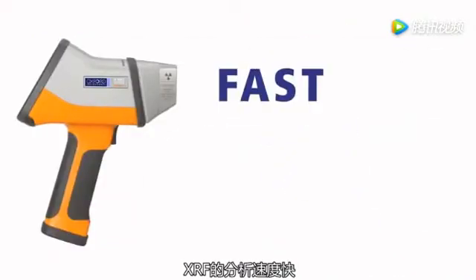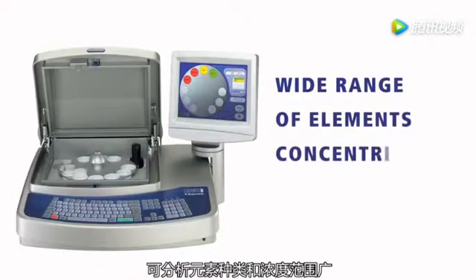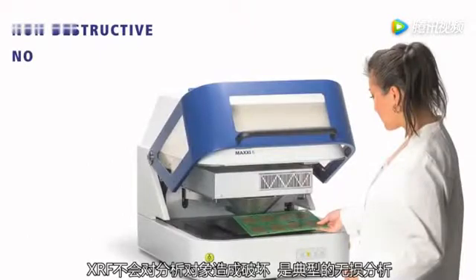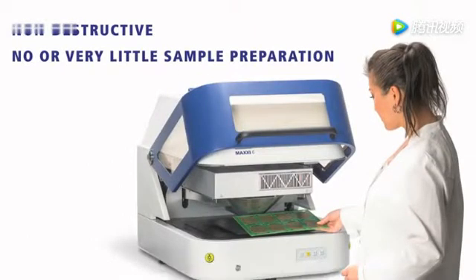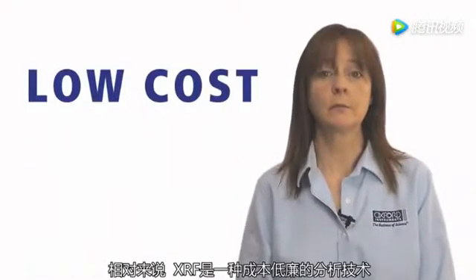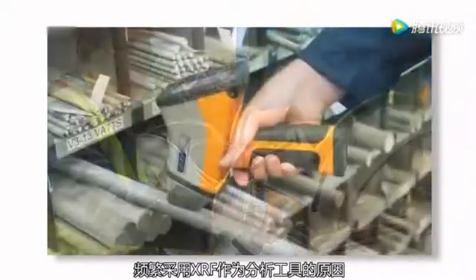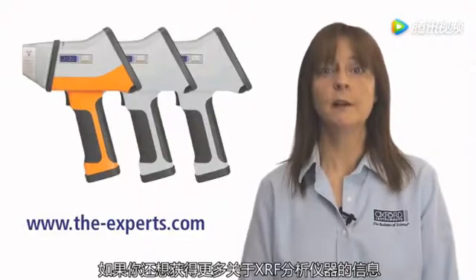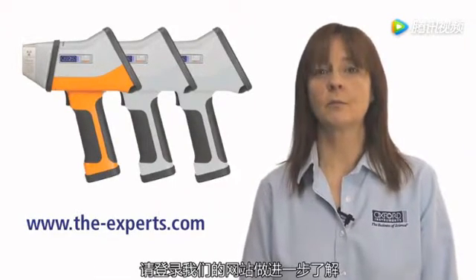It's fast. It measures a wide range of elements and concentrations in many different types of materials. It's non-destructive and requires no or very little sample preparation. And it's fairly low cost compared to other techniques. That's why so many people around the world are using XRF on a daily basis to analyze materials. If you want to find out more about our range of XRF analyzers, please visit our website.